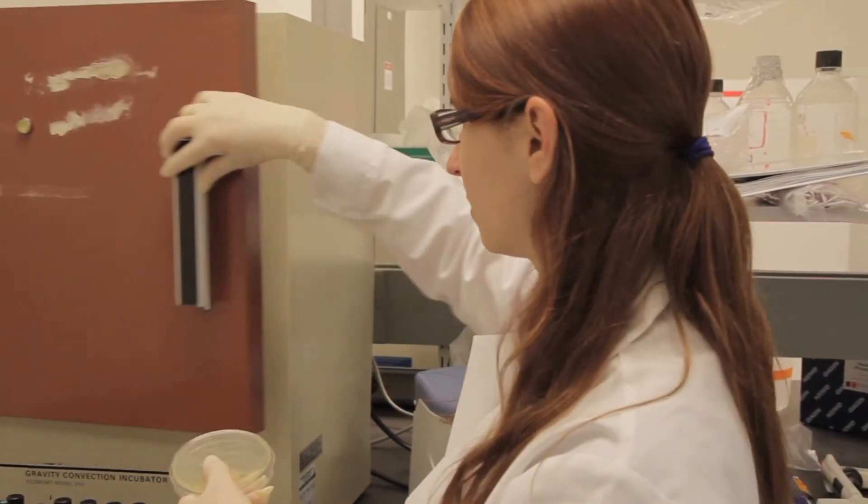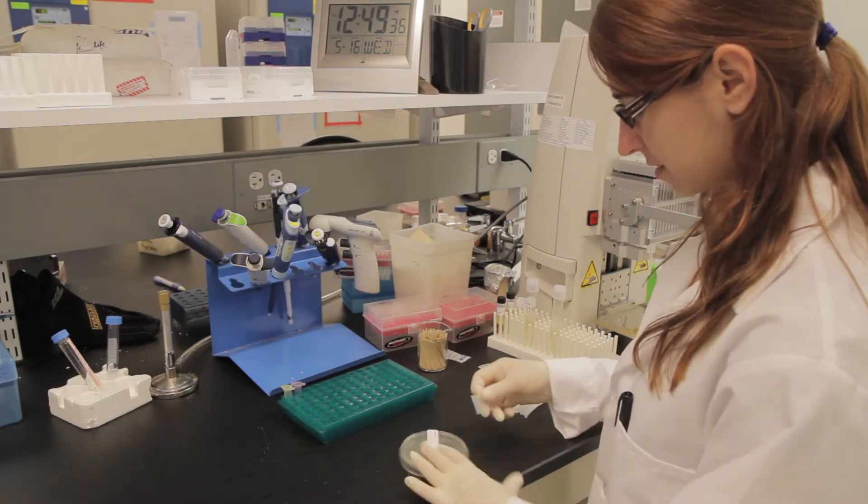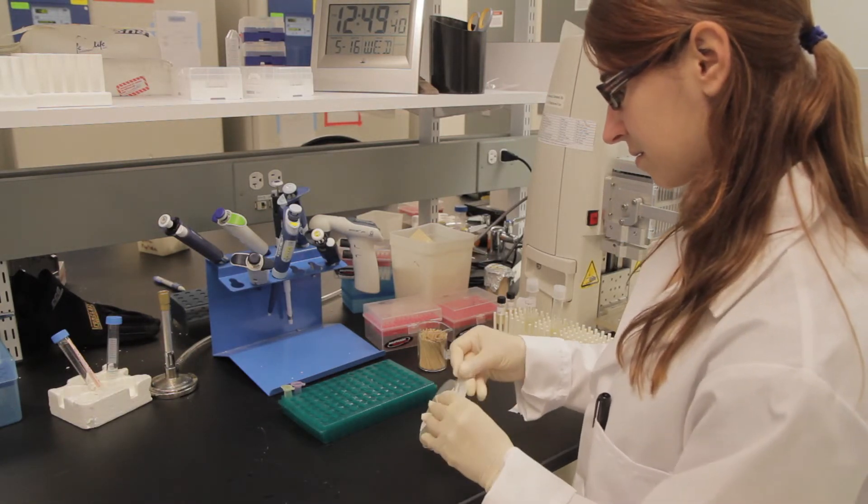Incubate your plate overnight to obtain bacterial growth. Attach the provided barcode, wrap your plate with parafilm, and send it to AddGene at room temperature.